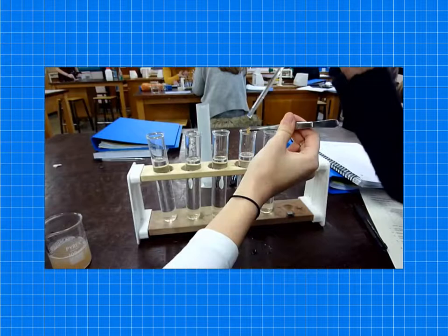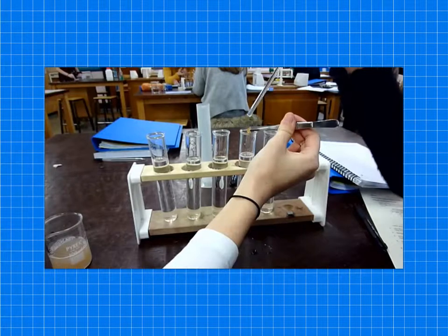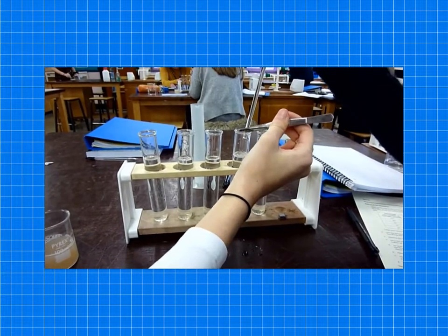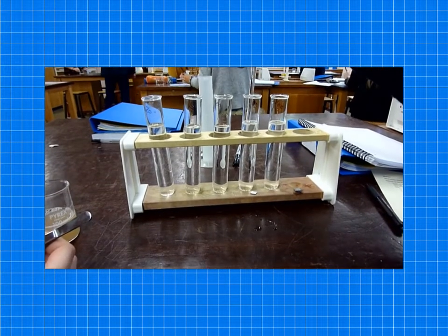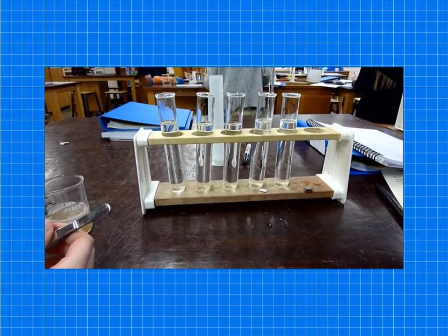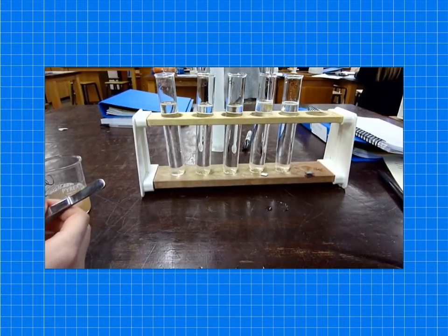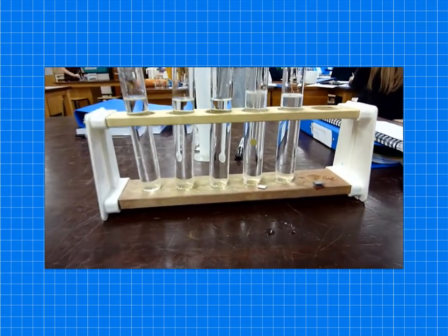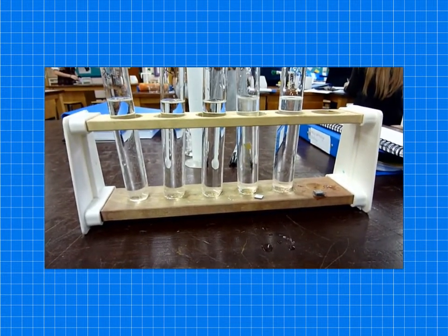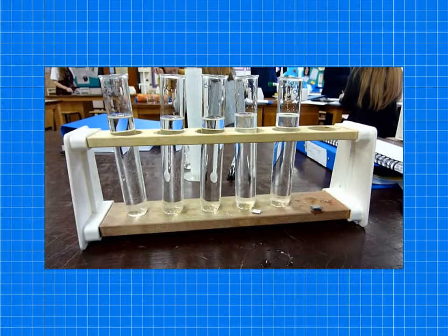So here we go. So this one was at 80%. And you can see the difficulties the students are having, and I had a go and it was very difficult to do, and they eventually get it. And once it's down at the bottom, they then would start the stopwatch and then record the time for it to come to the surface.